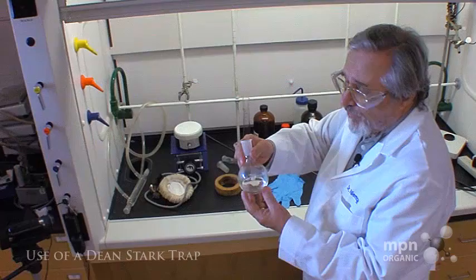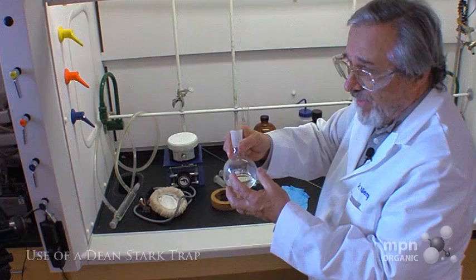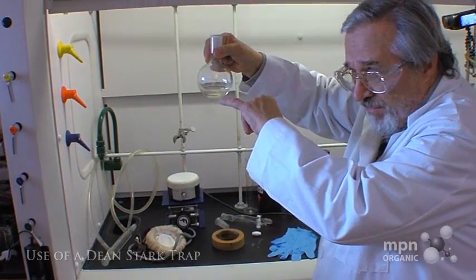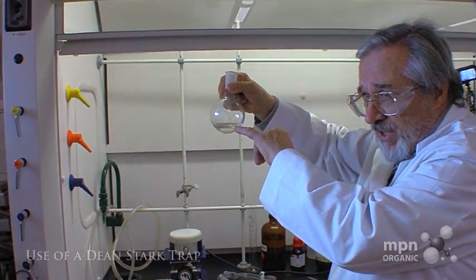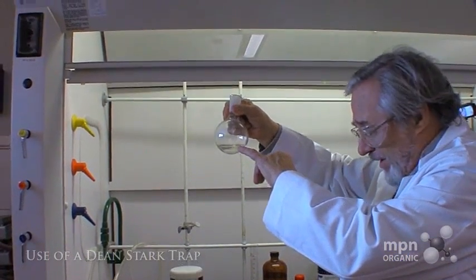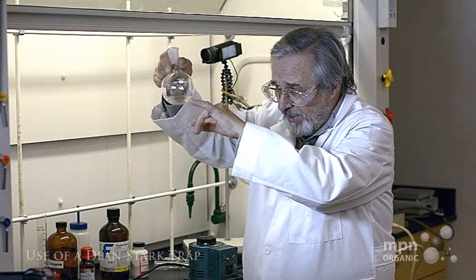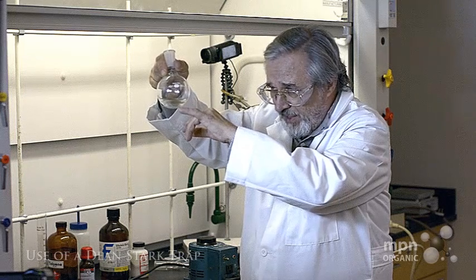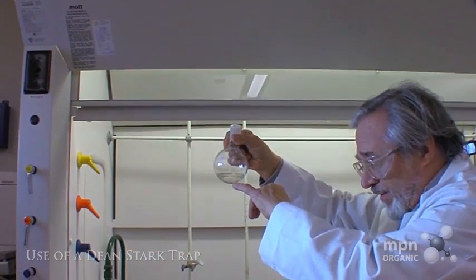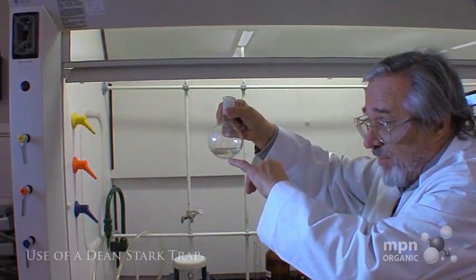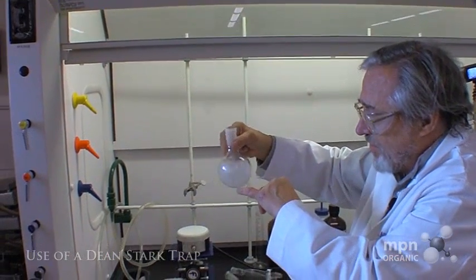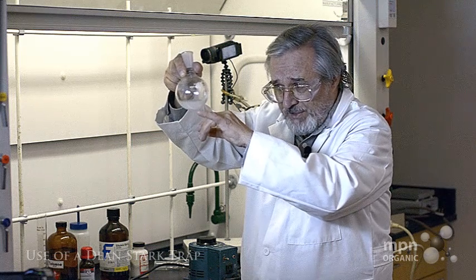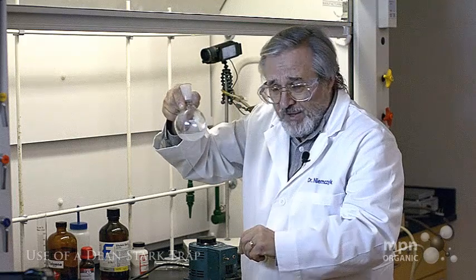Ethylene glycol forms a nice acetal with aldehydes, with my 4-methylbenzaldehyde here. I took the liberty beforehand to measure out 20 grams of paratolualdehyde. There is a layer of paratolualdehyde here on top, and on the bottom is a layer of ethylene glycol. You can see they're not very soluble in one another. When you shake this up it forms a kind of mayonnaise affair; eventually that will all separate out again.